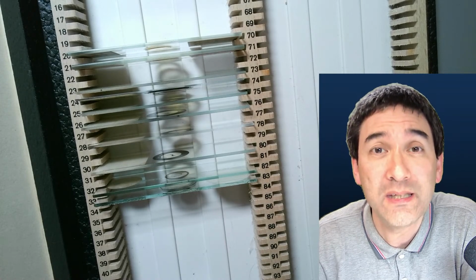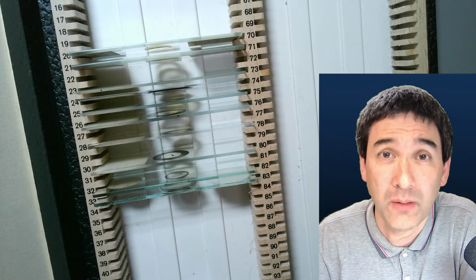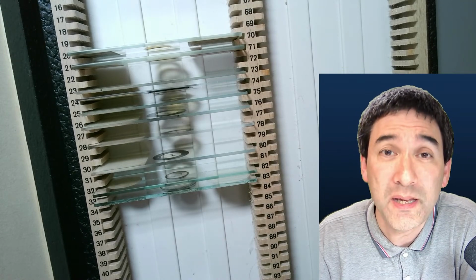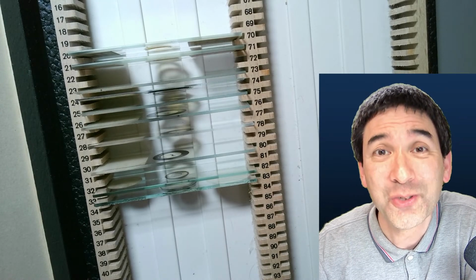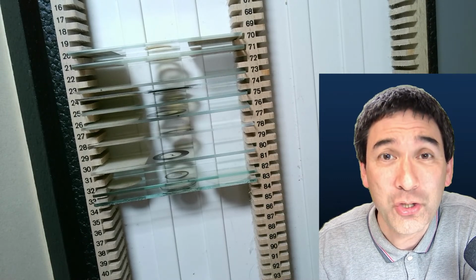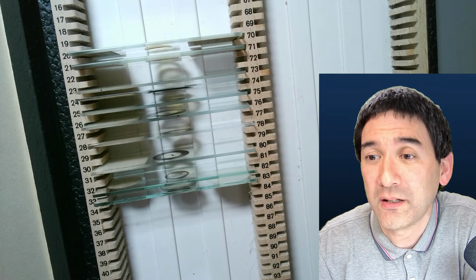Stitched image means that you can combine a video of the slide into an image. So basically you can really make very large pictures of this. Even if the specimen does not fit on the camera, you're still able to get an image with a full specimen. And that's kind of what I would like to do today.